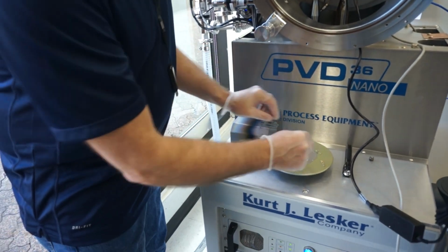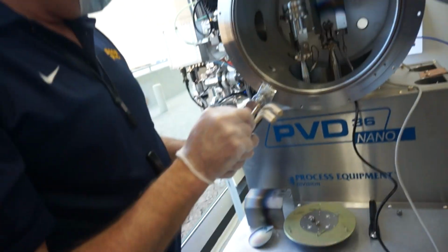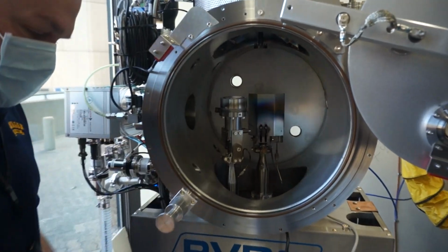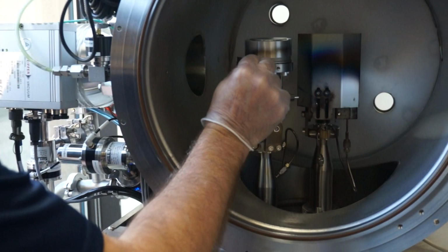Okay, so let me get some tools here. I apologize, I never remember if this is SAE or metric. I understand, moving back and forth hurts your brain enough. So I have both.